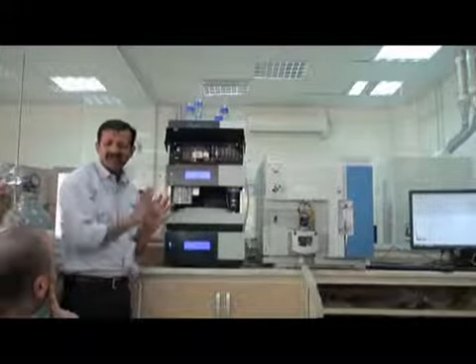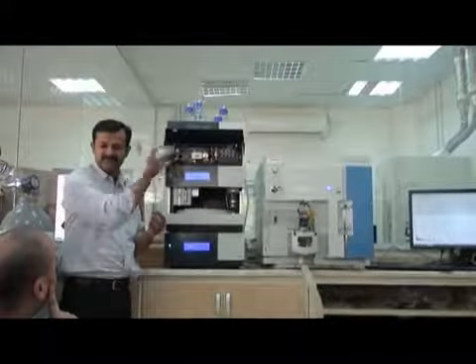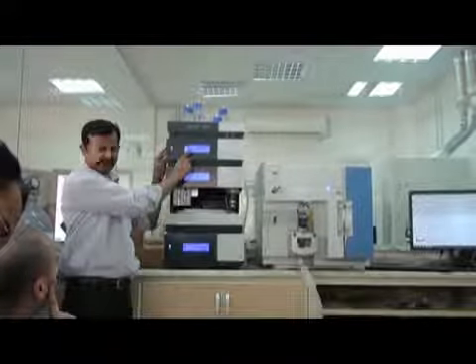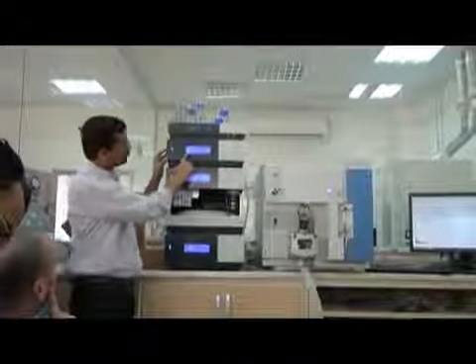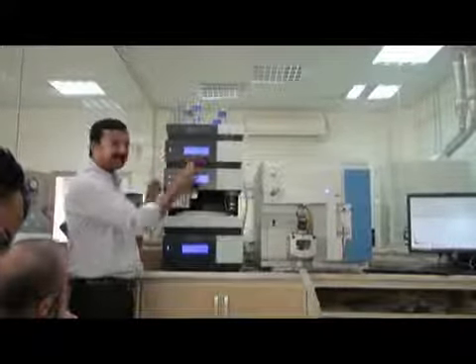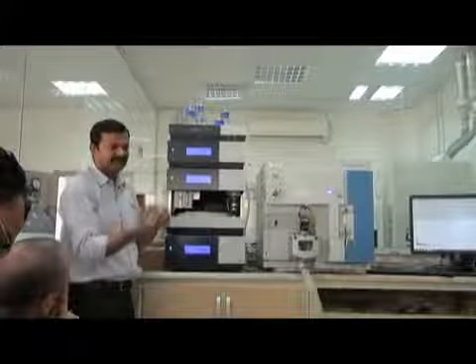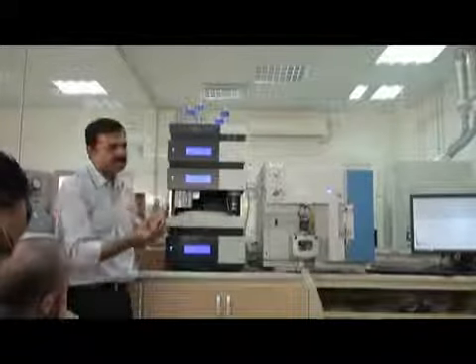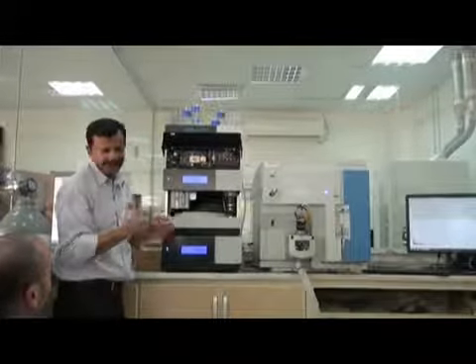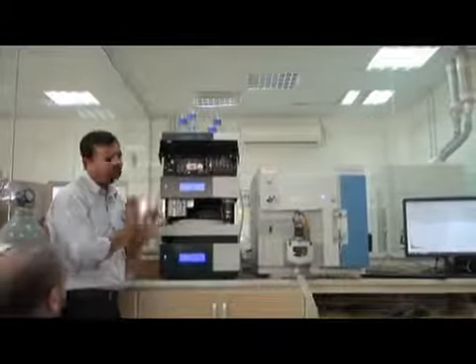It is automatic. Maybe every 5 minutes it will switch on when the pump is working. Now the pump is off. There is no flow. See, 0, 0, 0, 0, no flow. When the pump is working, this will start working, then stop, then working, then stop. It will be automatic. You don't need to control it. It will be automatic washing.